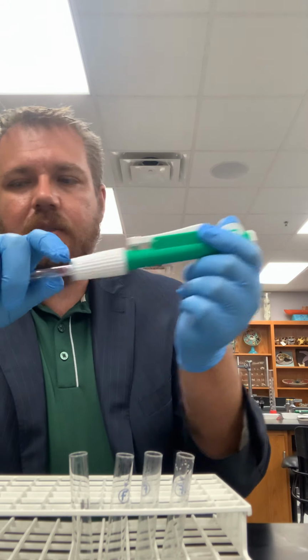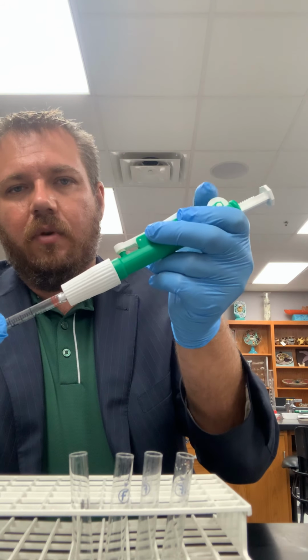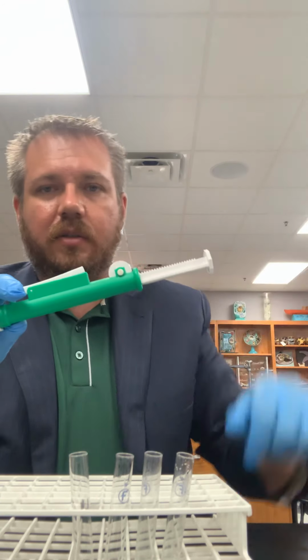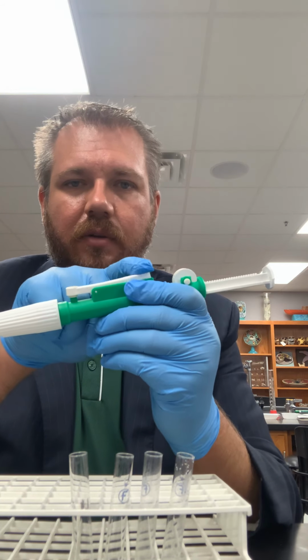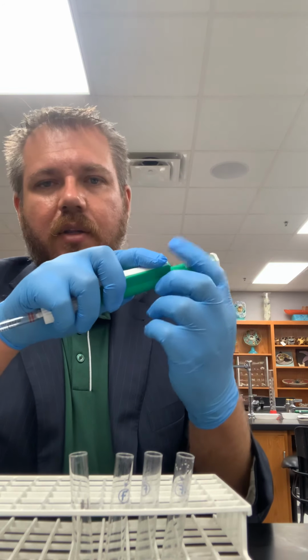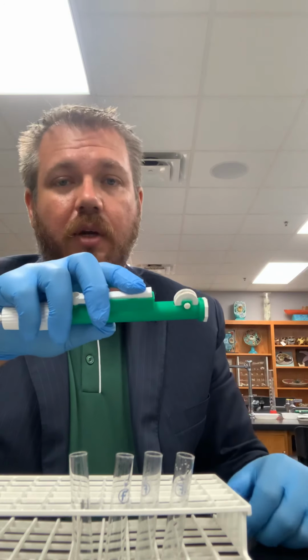Because what's going to happen is, the way this works is with suction, you're going to roll this wheel. If you roll the wheel kind of down towards your liquid, it's going to pull this part up, which is going to create suction and draw the liquid up. So this here is the trigger to release your liquid though. So you want to make sure that you're not holding that while you're drawing it up, or you're not going to draw anything up because it's not going to be able to pull the liquid.